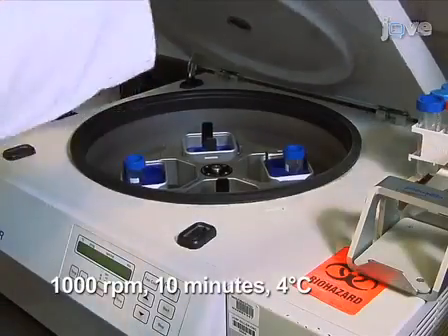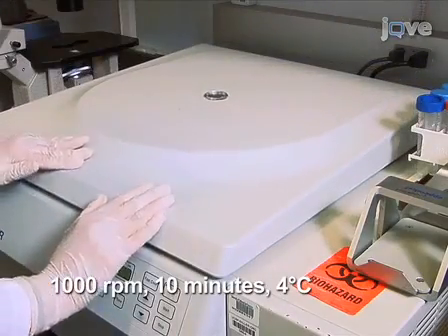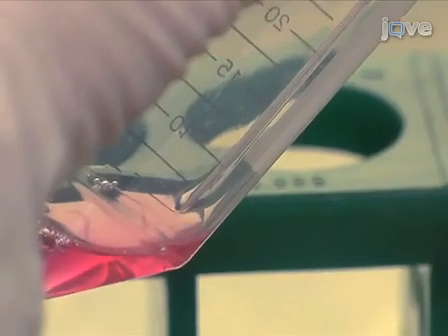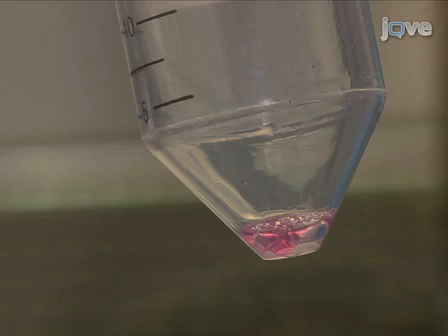Centrifuge the suspension at 1000 rpm for 10 minutes at 4 degrees Celsius. Following centrifugation, aspirate the supernatant. Then, resuspend the cell pellet in an appropriate volume of serum-free medium to obtain a final working concentration.